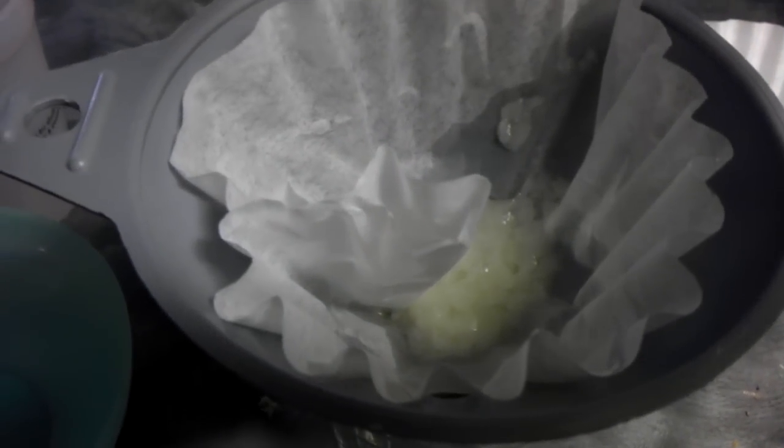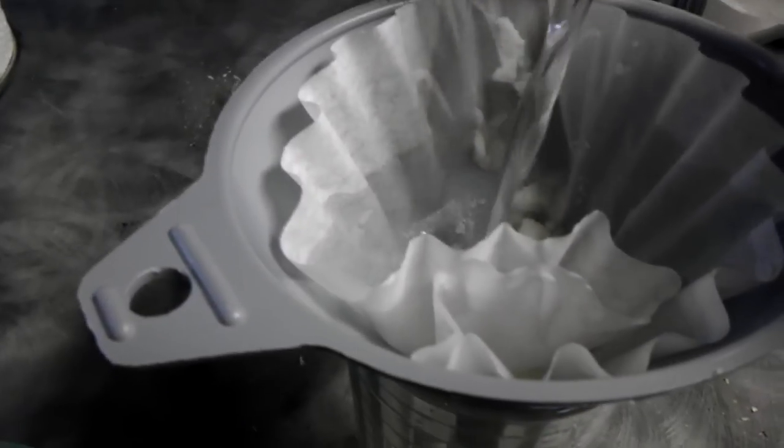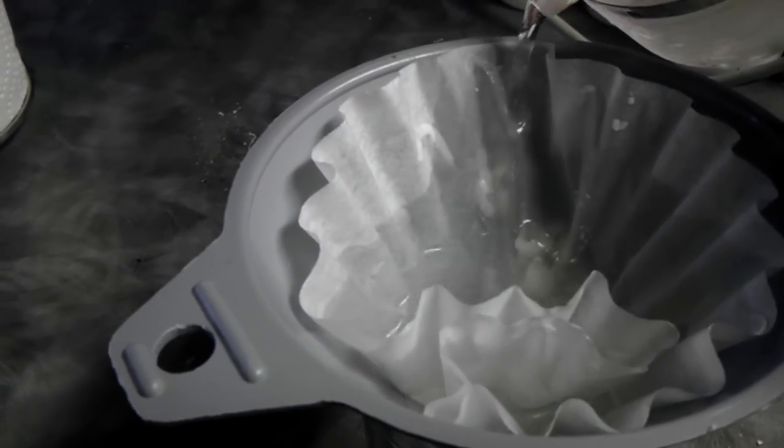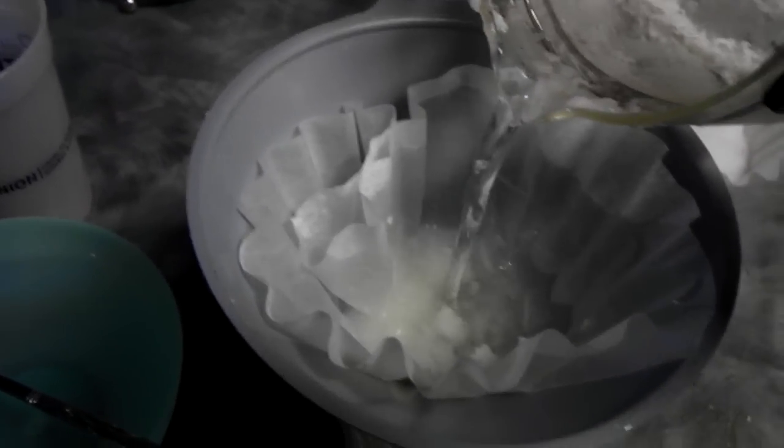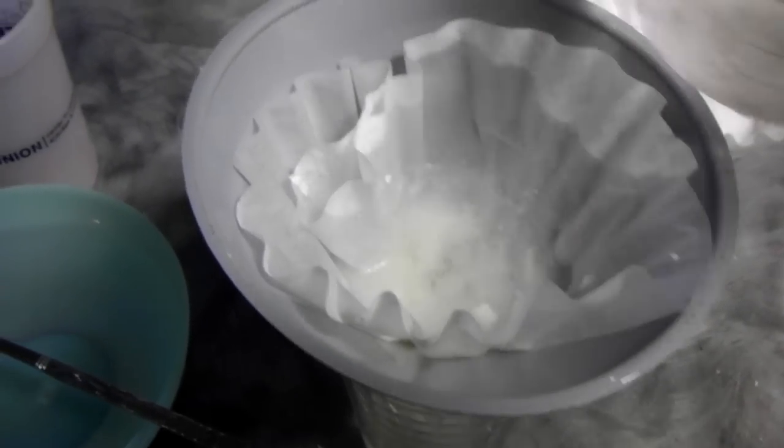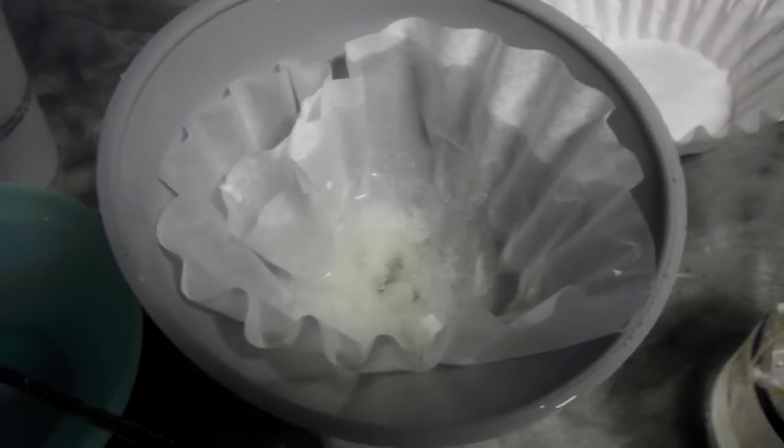Make sure all of the liquid is out so your product is in a clean filter now. Rinse with ice cold water. Rinse again with cold water. One more time.